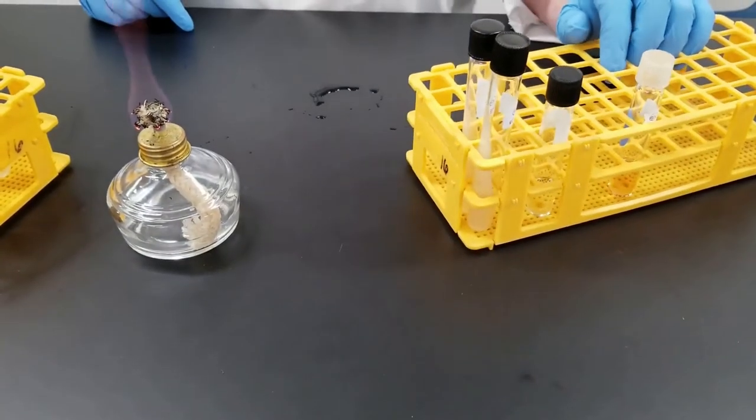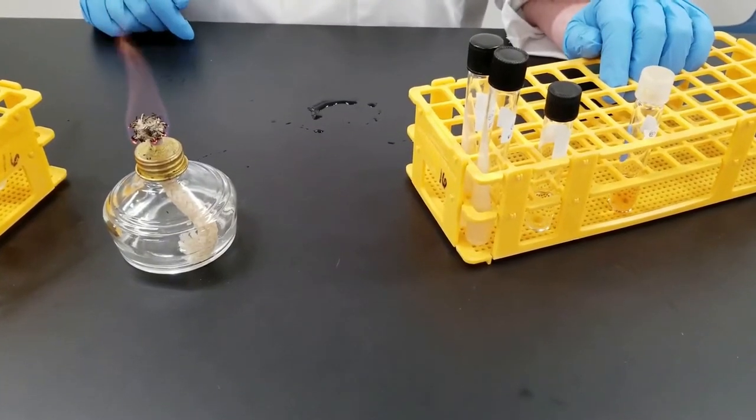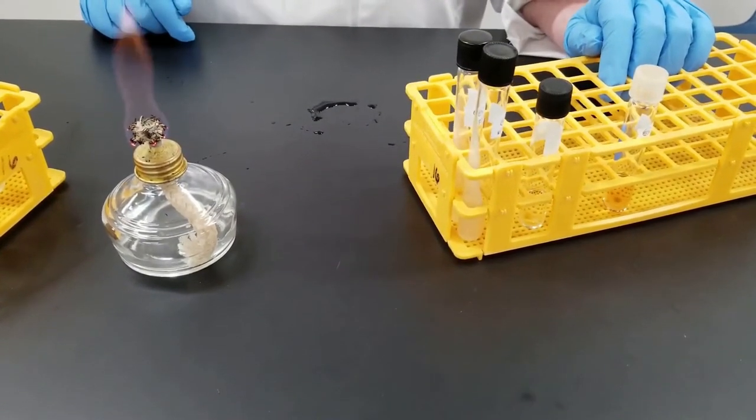We're going to do several inoculations. Here we're going to use the culture Serratia marcescens, which is a gram-negative bacteria.